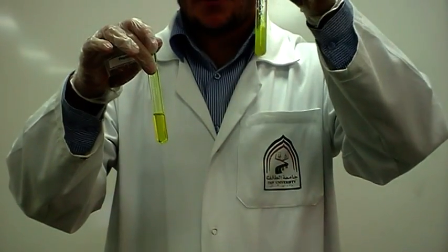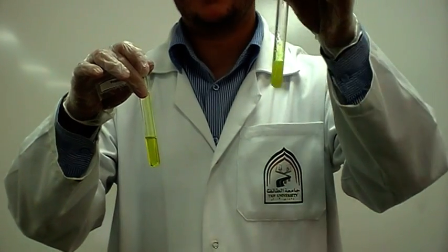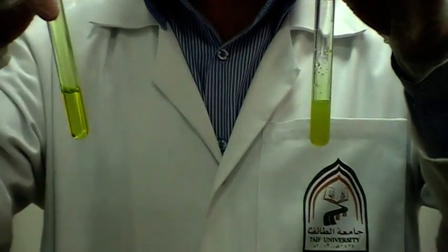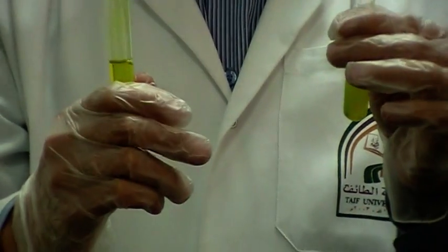We have gelatinous solution, yellow gelatinous - this means you have gelatin. We will get yellow color - this means you have peptone. Thank you.